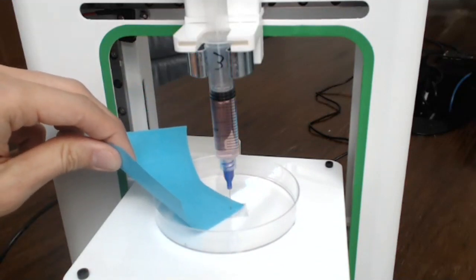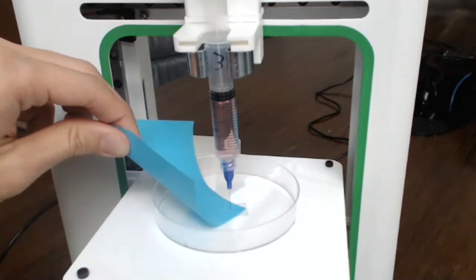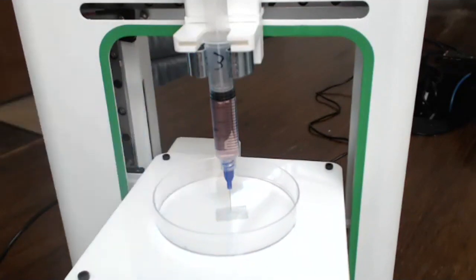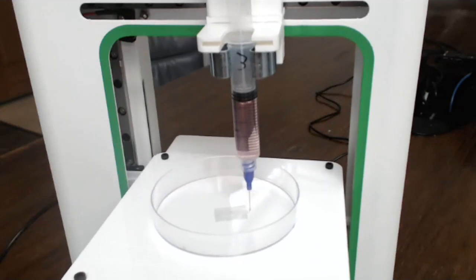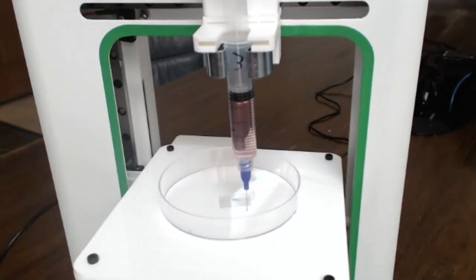So just to clarify, there was a question about the different materials that we're using. Today we're only using a pluronic material, and so far we've only adjusted the viscosity. One of the activities we did was lowering the viscosity, but everything else was on the standard pluronic concentration that we typically use for printing scaffolds. So we haven't really played with other materials, at least not in this webinar. We're not showcasing different materials.